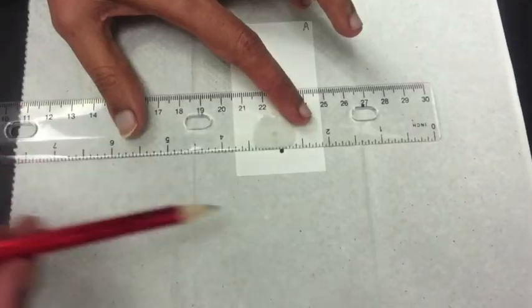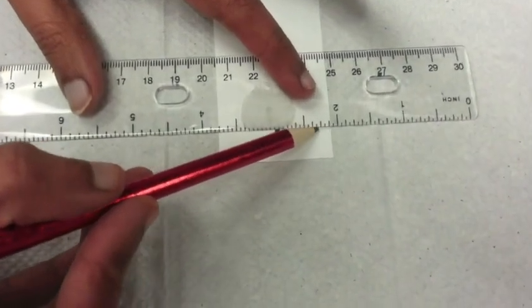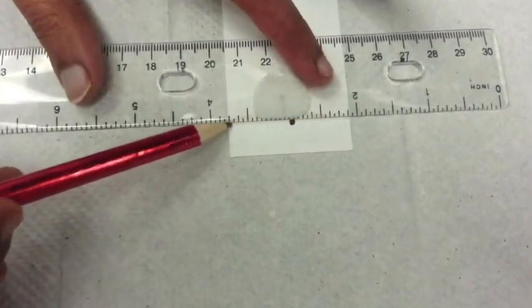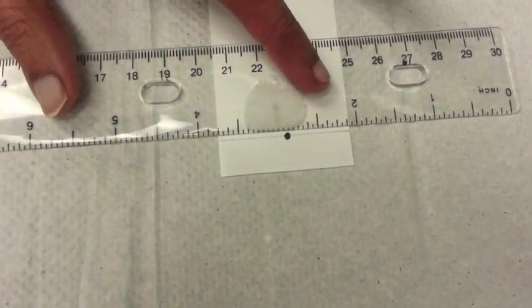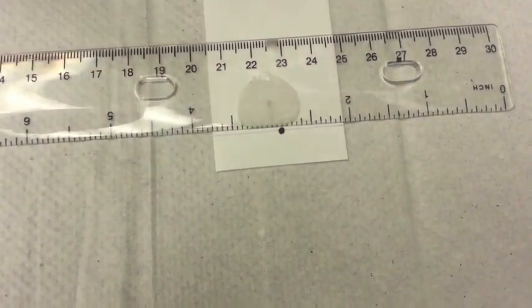To get started, you use your pencil to draw a line on the provided chromatography paper which already has a known ink. Make the line very thin and barely visible.